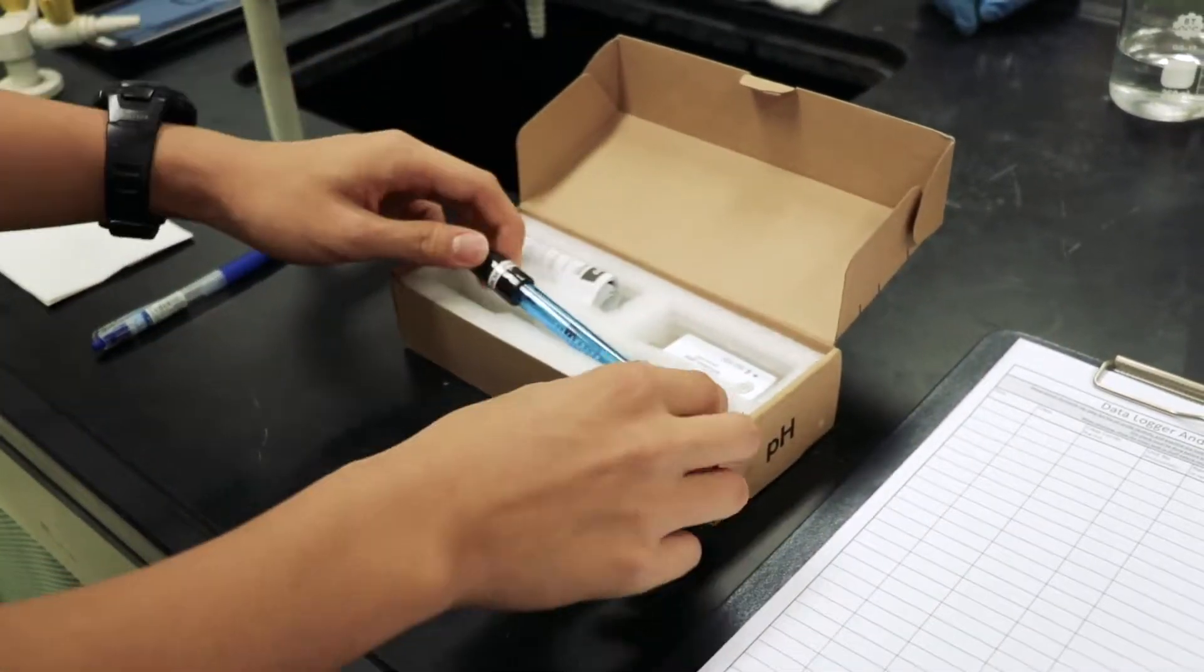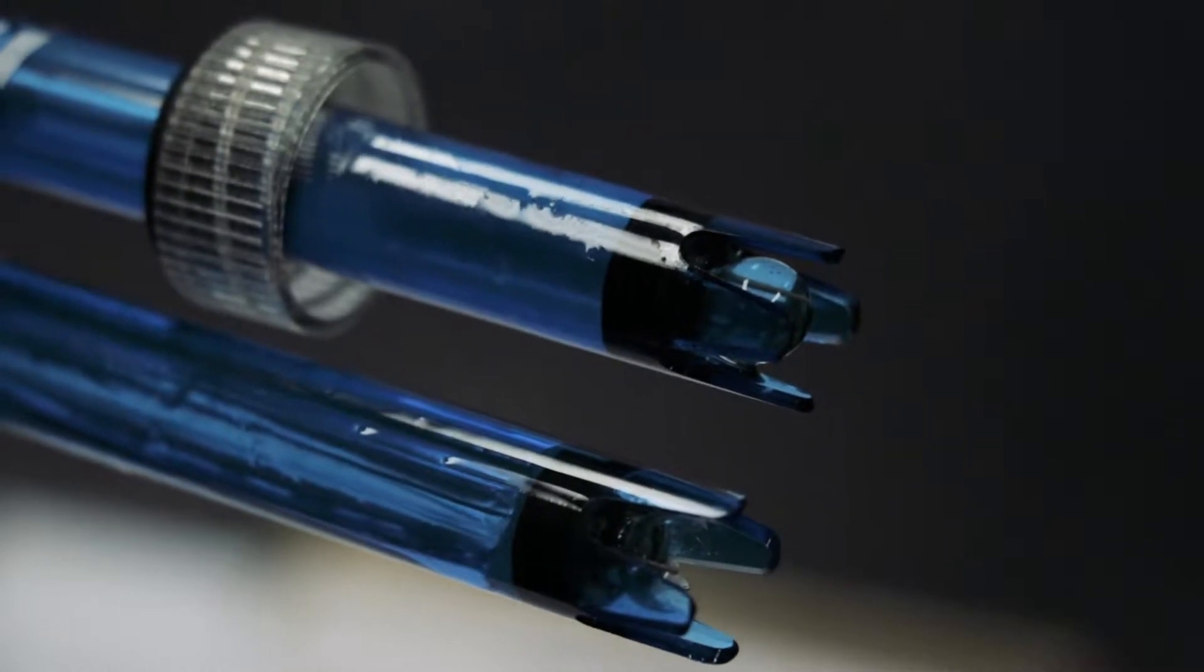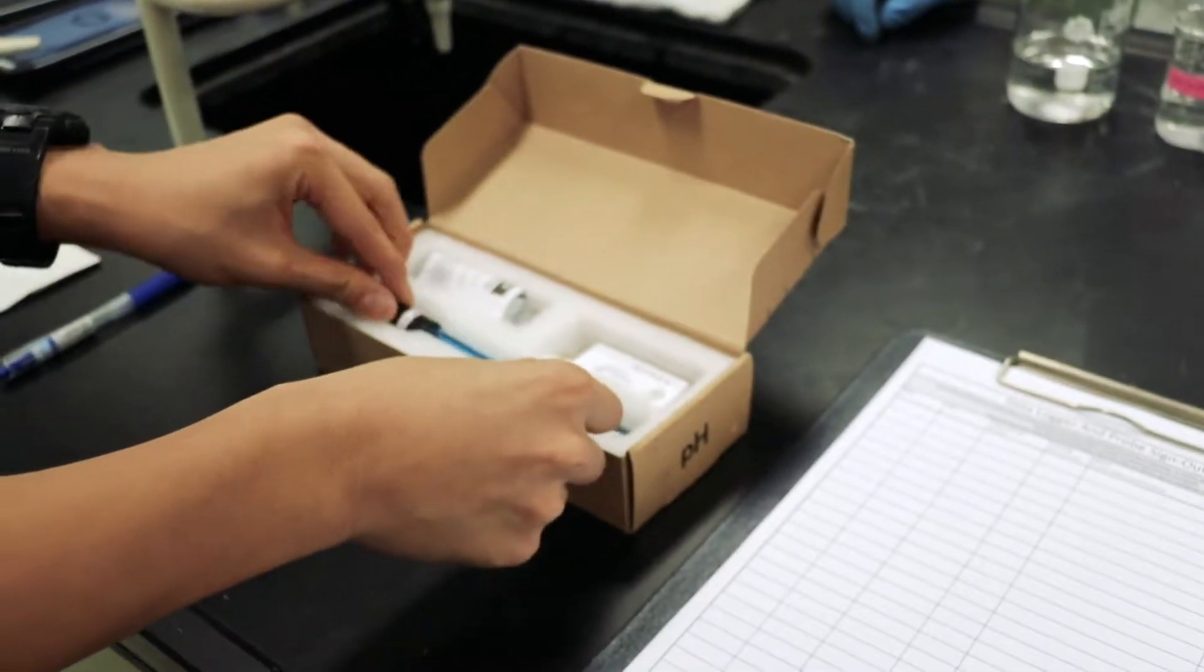When signing out for the Probe, inspect the bulb to verify that it is intact before leaving the sign out point, in the presence of the lab technician or teacher.